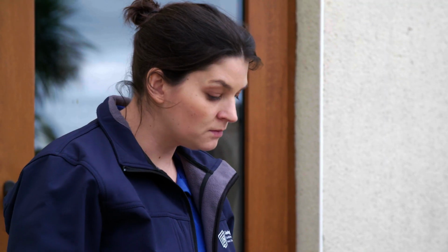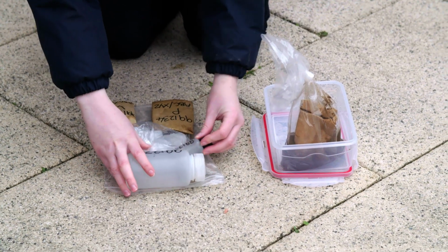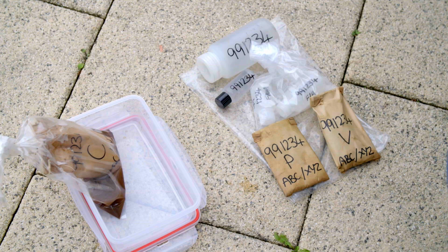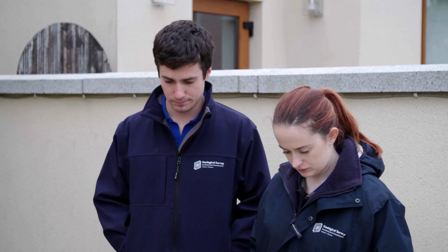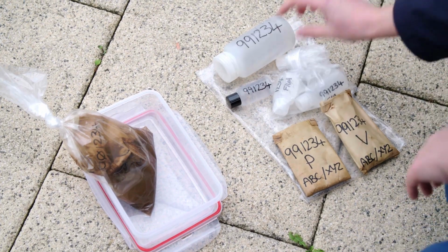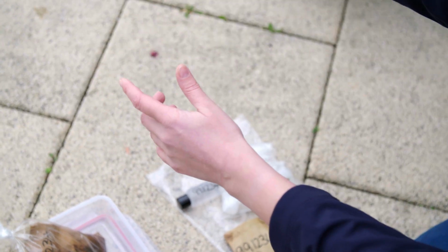Remove all other samples from their site bag and lay them directly on top of the site bag. Position samples so that the site number is upright and clearly visible. Field management personnel must inspect all samples before checking them in. Inspect the large 250 milliliter and small black-capped 60 milliliter unfiltered water samples.